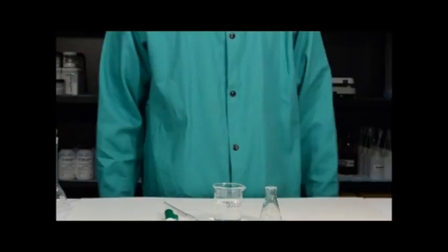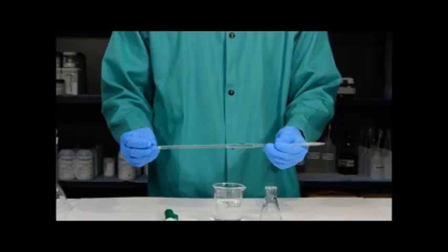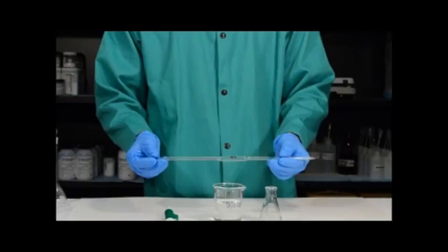Then using the temperature of water and the density you will determine the volume of water transferred for each trial. By doing the experiment repeatedly you will test the precision of the experiment. Since this is a five milliliter volumetric pipette you will test the accuracy because you know it should deliver five milliliters of water, and you will use that as your standard to determine your percent error.